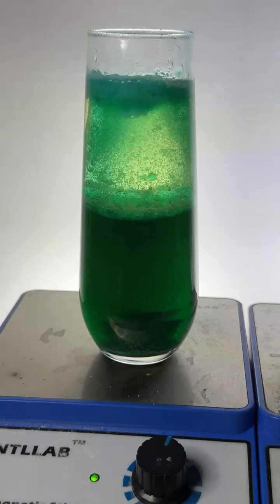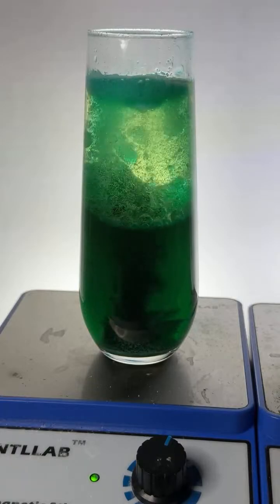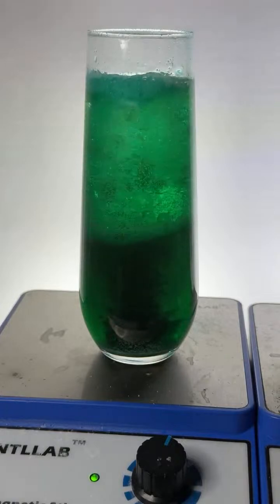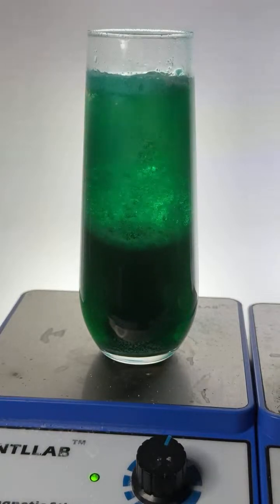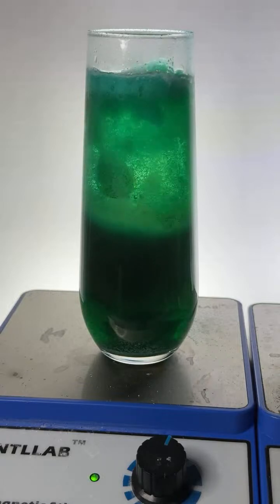Wouldn't it look cool without adding dyes as well? Let's find out. We're going to do one without adding dyes. I bet you're right. I bet that would look prettier because the dyes are obscuring everything. It does look like a mess. What a bust.